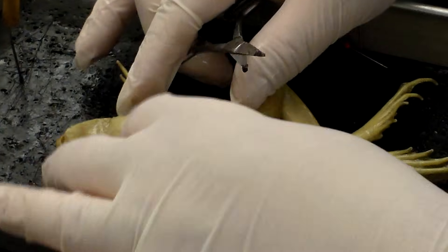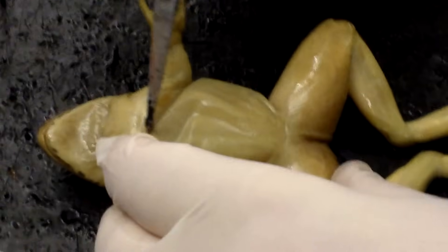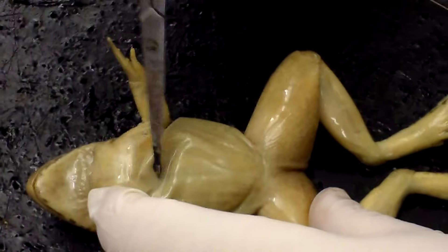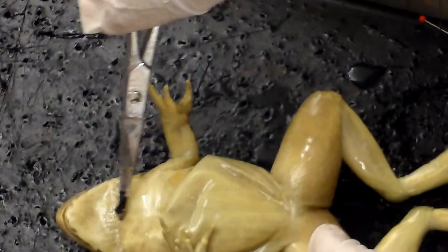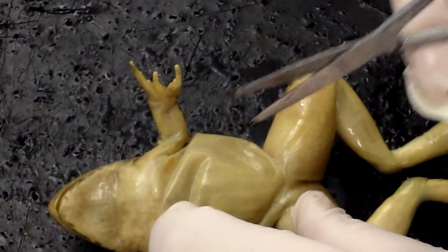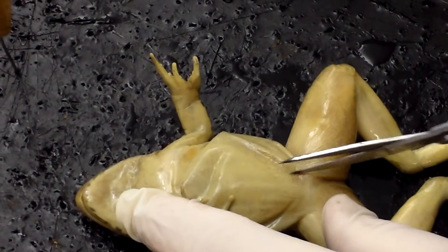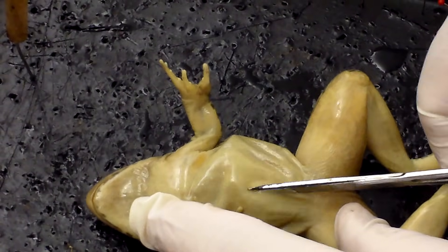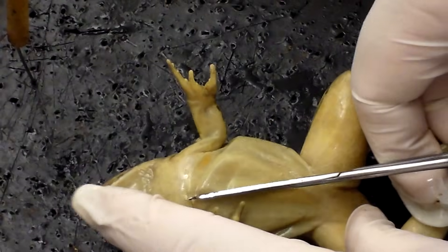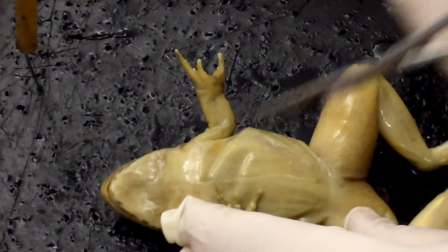In order to do that, we have to make a couple of incisions. We're going to make an incision from the bottom of the abdomen all the way up through the breastplate. That's actually bone up here, so the first part is only skin — when we get up here it's through bone, which is a little more difficult to cut. You don't want to go too deeply; you want to go in through the muscle and layer of skin so you don't damage any organs underneath. Keep your scissors kind of pulled up.